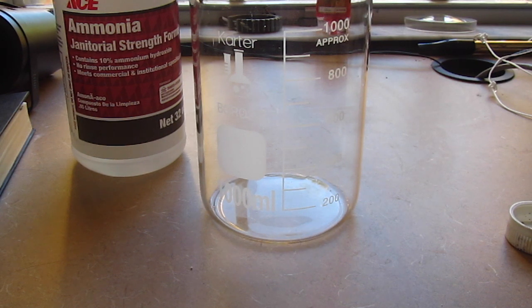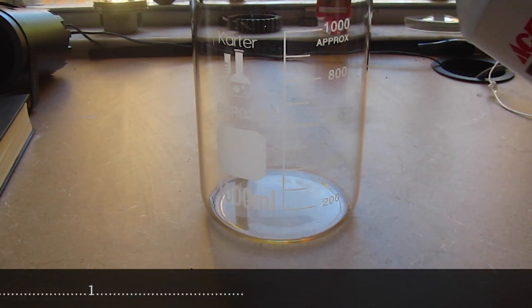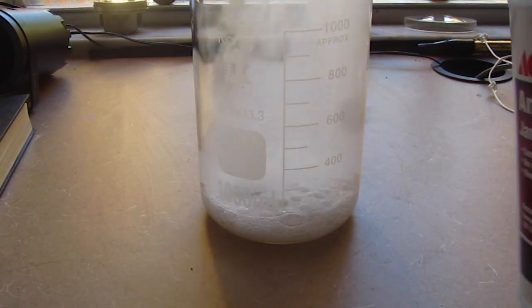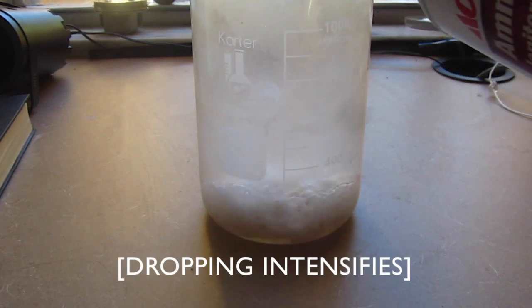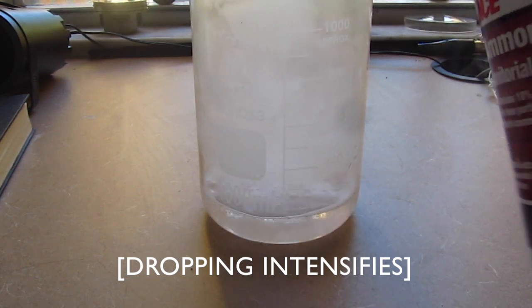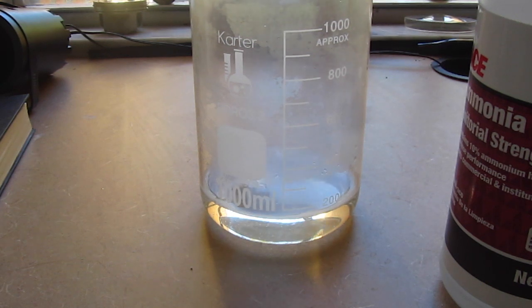Anyway, this is 98% sulfuric acid, which I mixed with 10% ammonia. Both are just extremely concentrated, and it instantly boils over, sending a cloud of ammonia gas into my room. I wanted to run out already, but I had to have that little bit of extra ammonia, and then I ran out of my room for about 30 minutes. It was pretty bad, but I'm okay, and I got some cool crystals out of it, so I guess everything's okay, right?